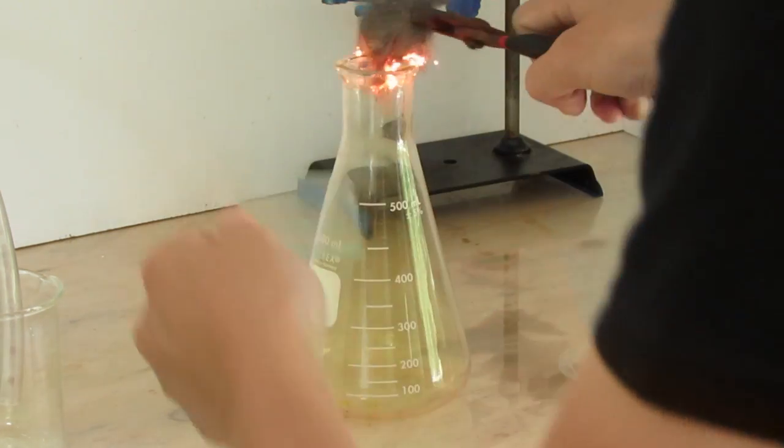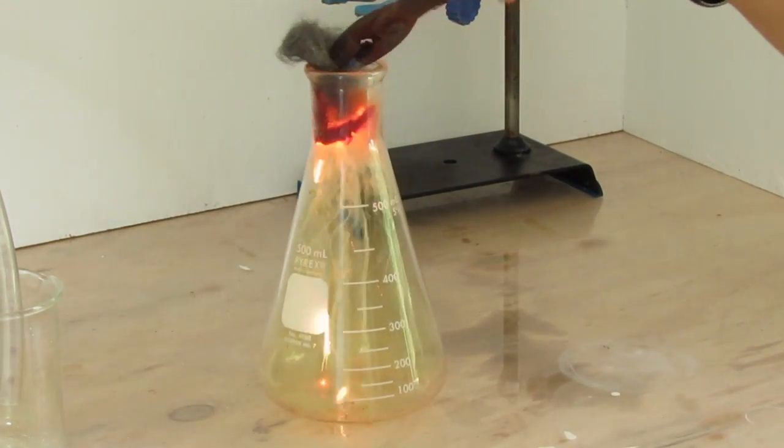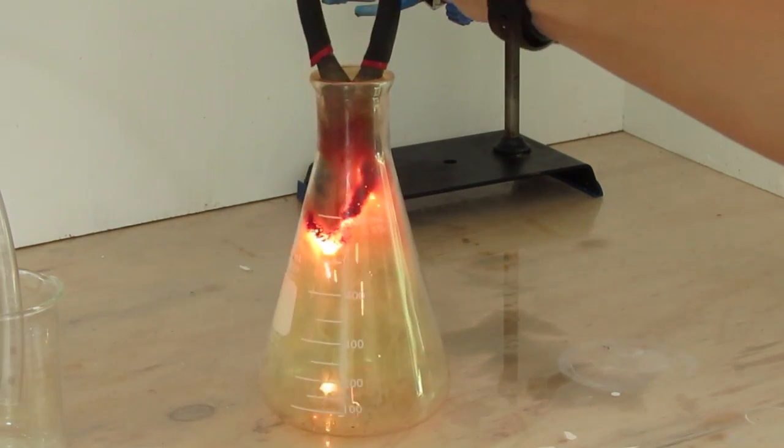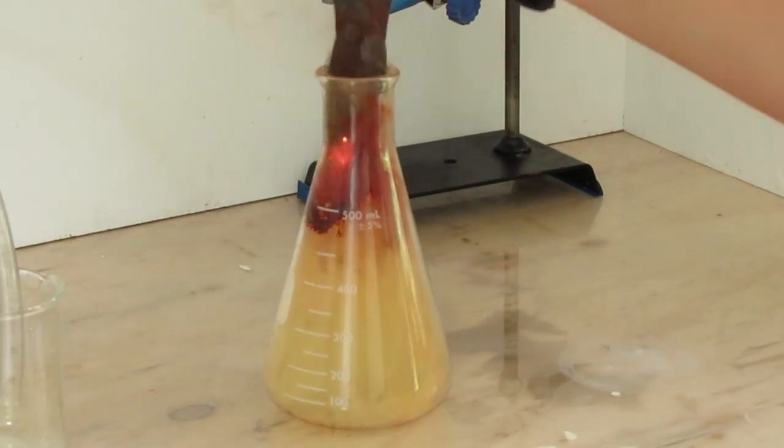So I am going to do this again, just a little more zoomed out. I don't quite get it in there this first time, so I try it again. So I pull it out.